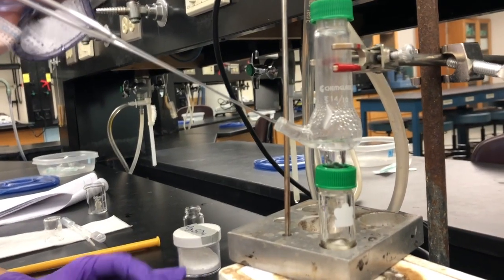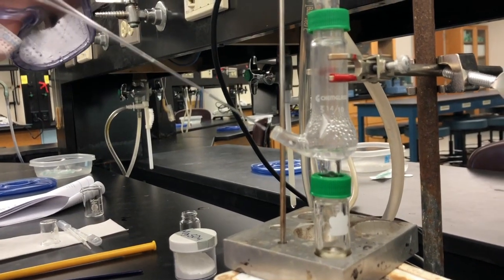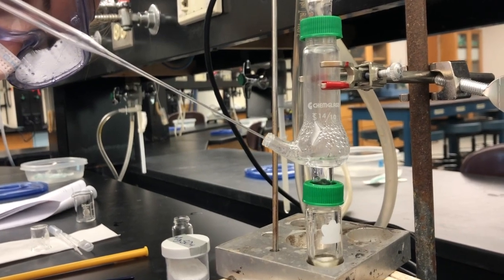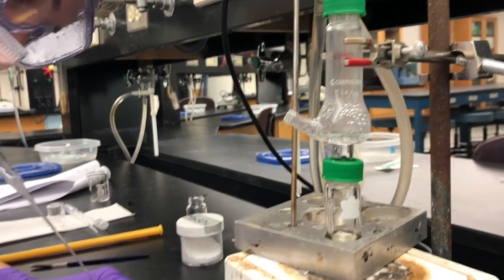Patiently wait for the distillation to run. As product forms, collect it using a pipette and place it into a vial. Make sure it is not the same vial that you pre-weighed.